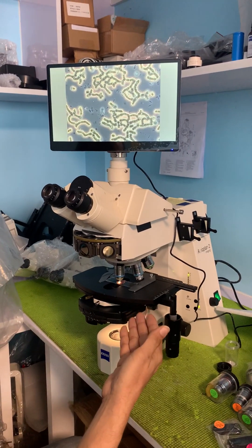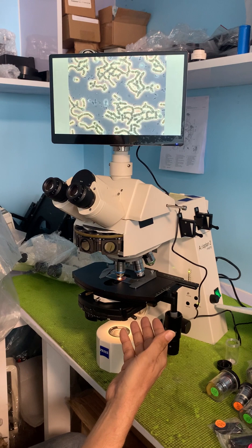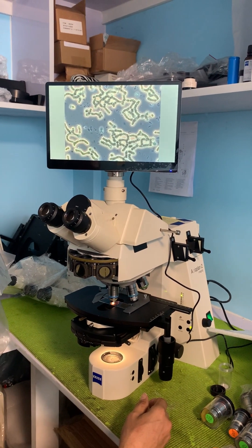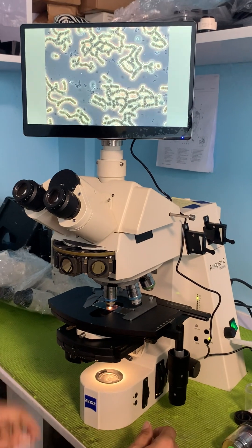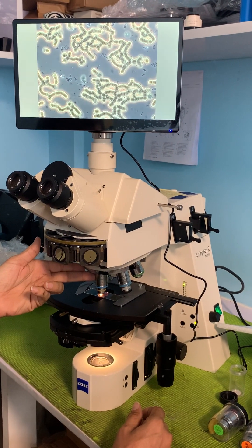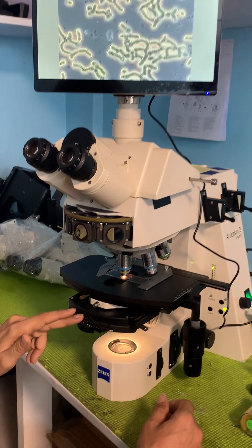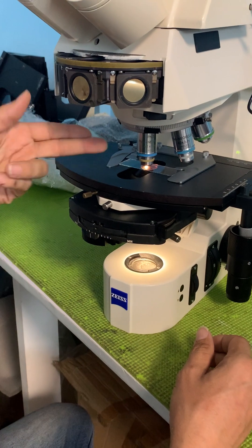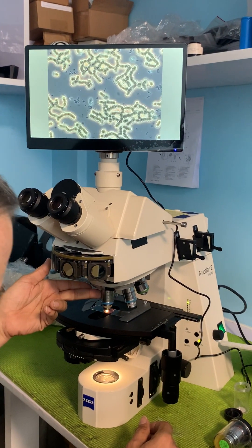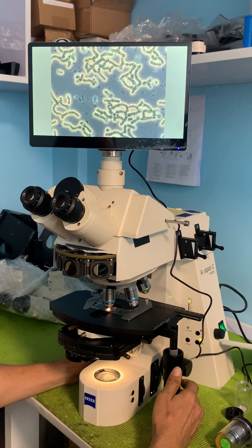Today we're going to try looking at some live blood with a Zeiss Axioplan II imaging, and we're going to look at it with phase contrast as well as DIC. At the moment I have a Plan NeoFluar 40X phase objective. I've got the phase annulus set to pH2, which matches the pH2 annuli in the objective, and I have it in focus.